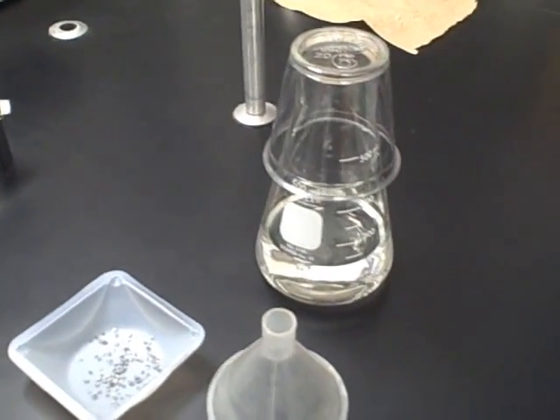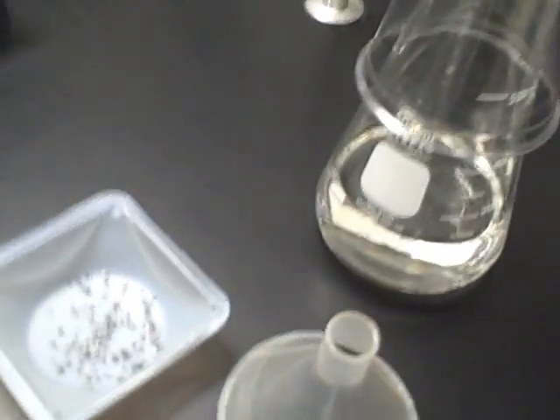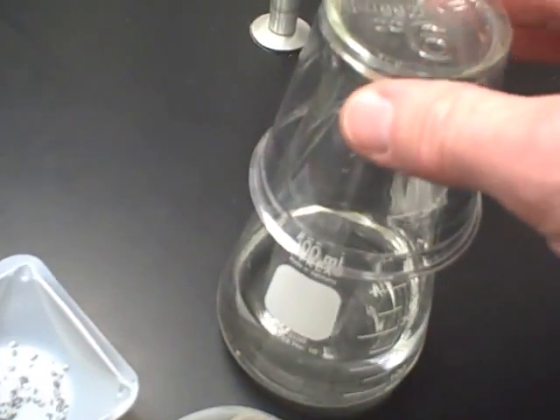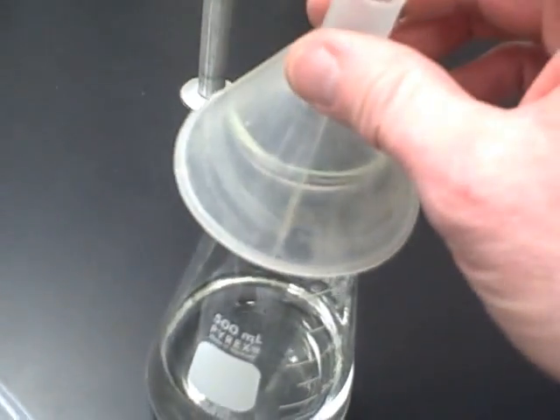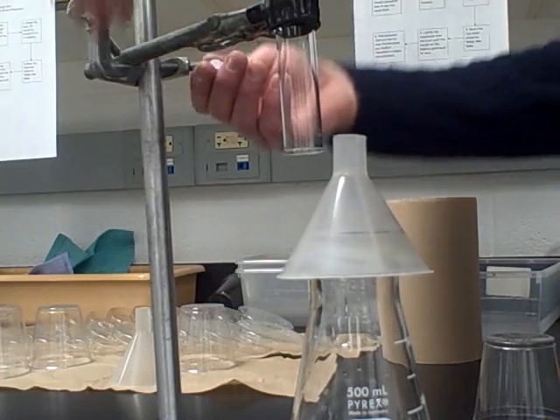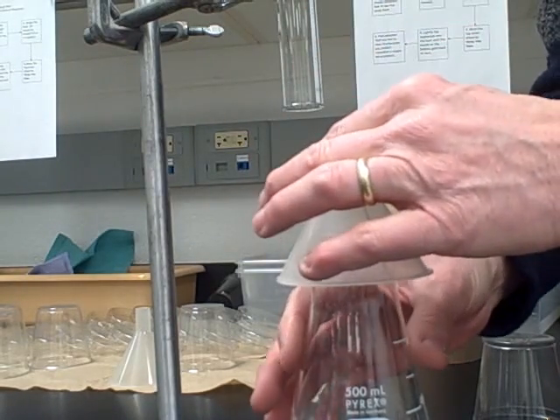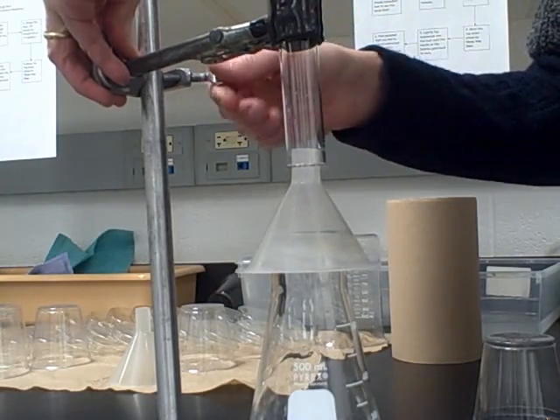In the next step, make sure your safety glasses are on because now we get into the danger part of this lab. In our flask we have hydrochloric acid — very strong — and we keep a cup on top to prevent fumes from escaping. We're going to take that off, put the funnel on top, and get things set up so that when we put the magnesium in and the reaction begins, we slide the funnel under the test tube and lower it down so it collects the hydrogen gas.